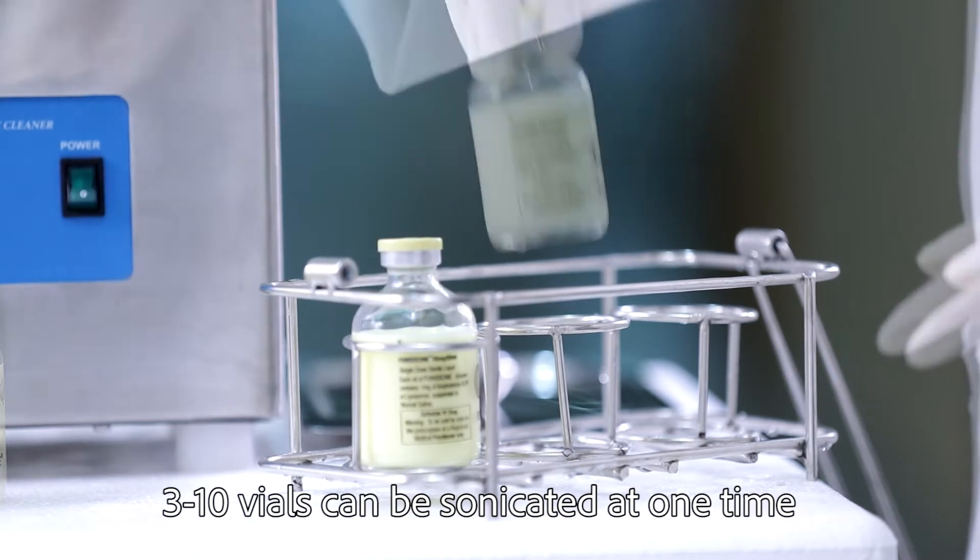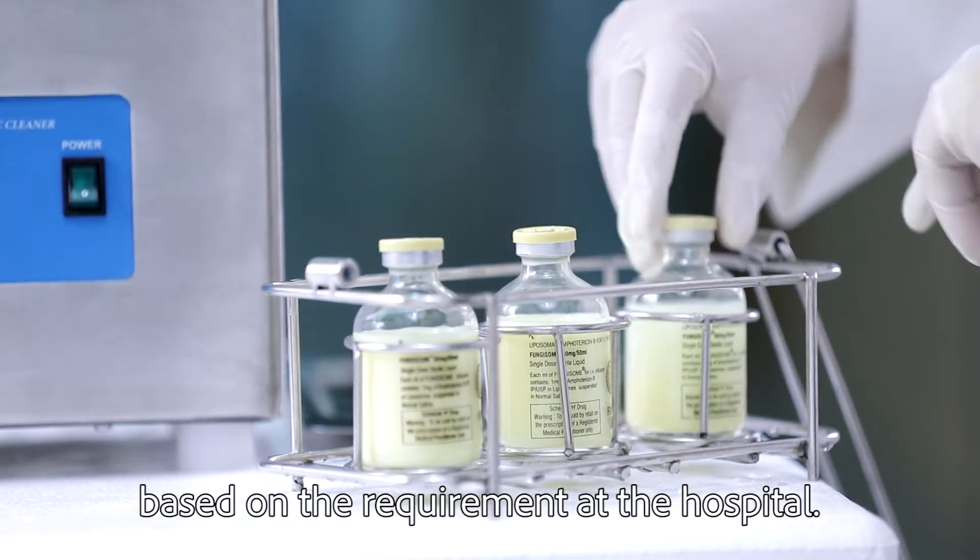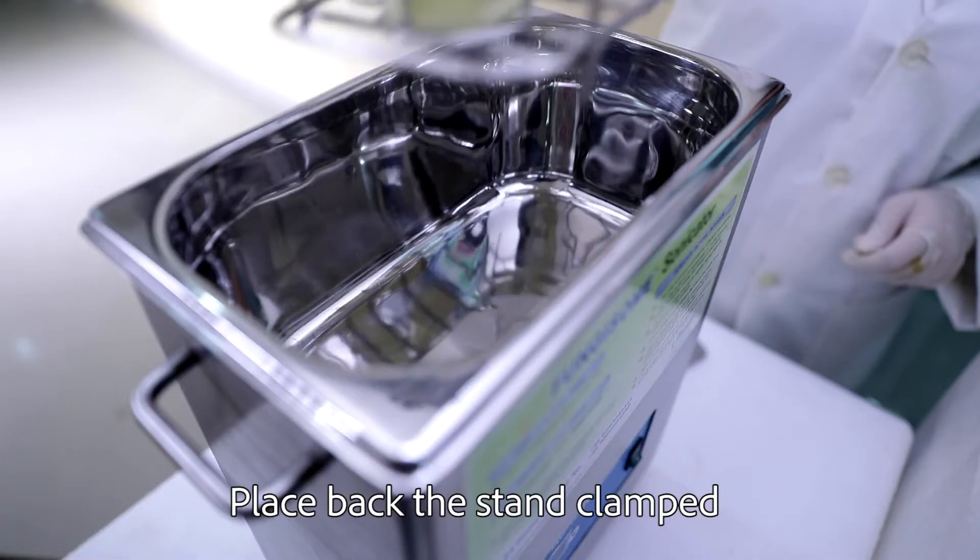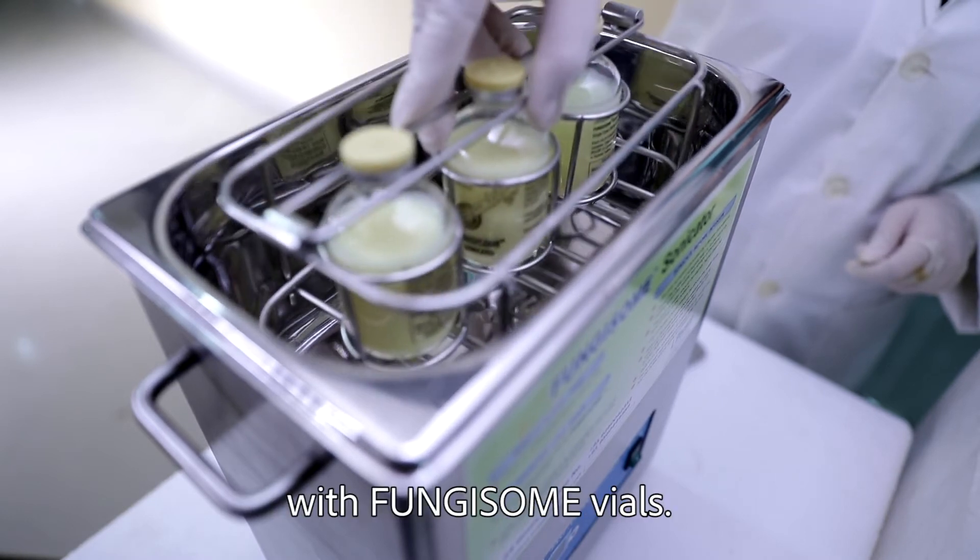Three to ten vials can be sonicated at one time based on hospital requirements. Place back the stand clamped with Fungisome vials.